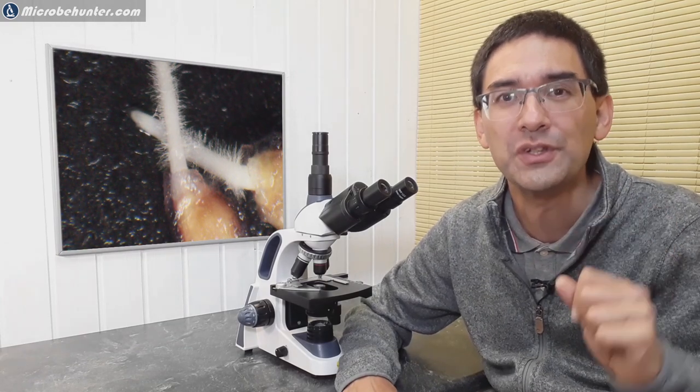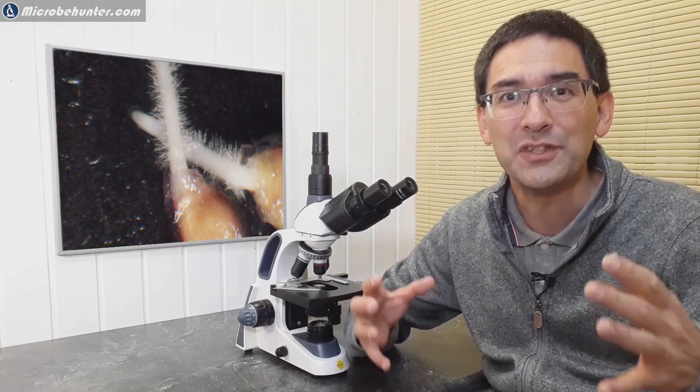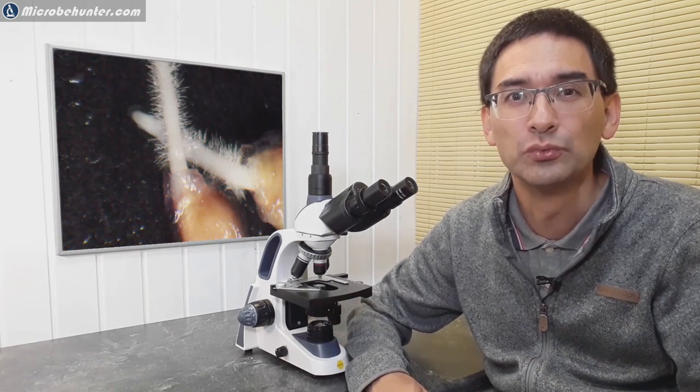I'm going to show you today how you can actually observe the growth of the roots under the microscope. Even after a few minutes, you're actually able to see that the root will grow a little bit, because the microscope magnifies even the very small and very slow root growth. It's an easy and simple straightforward experiment, and I'm going to show you how you can try this at home.